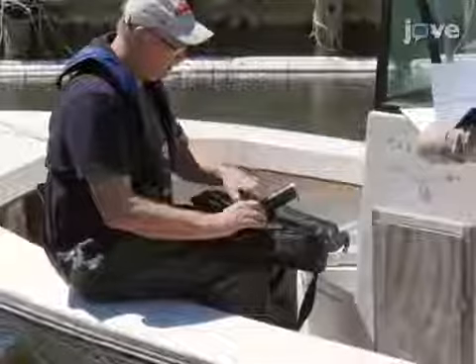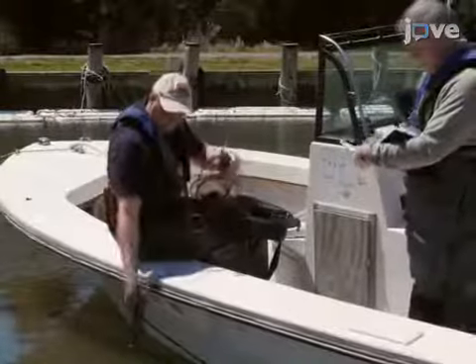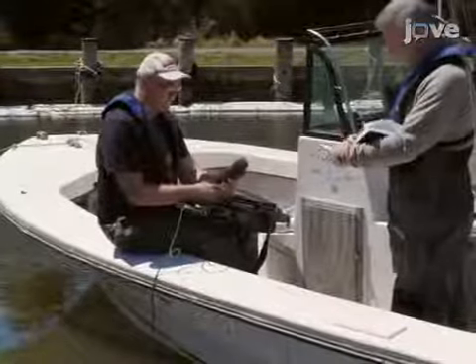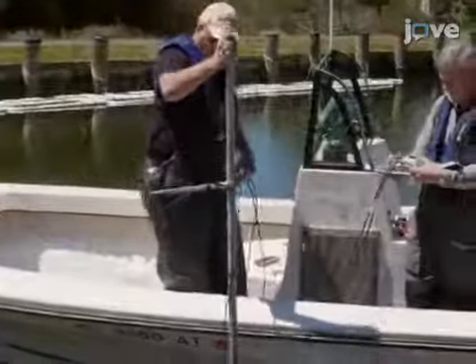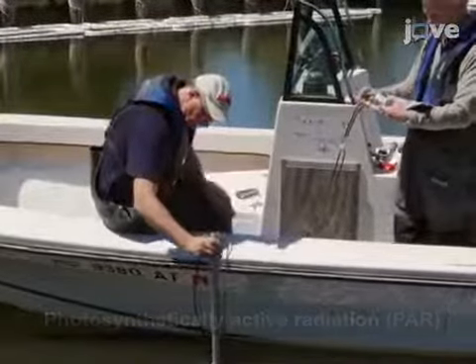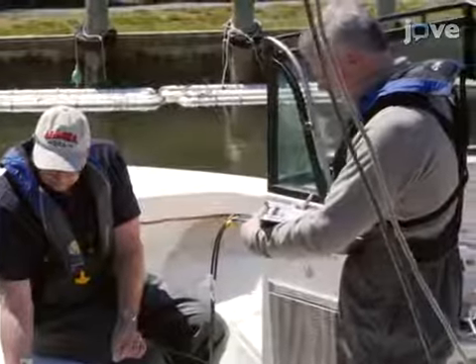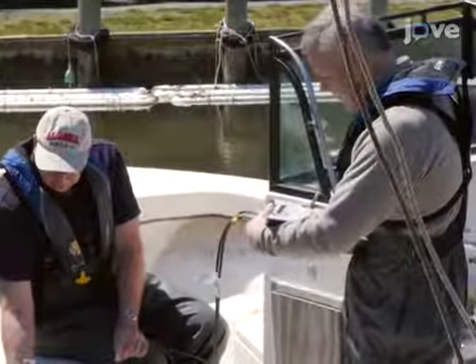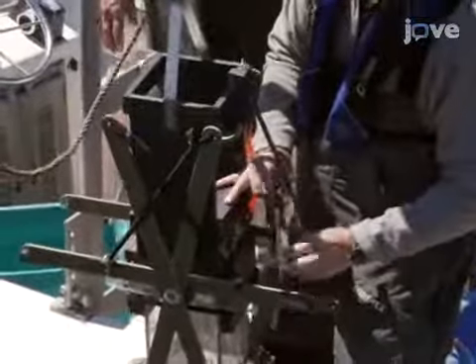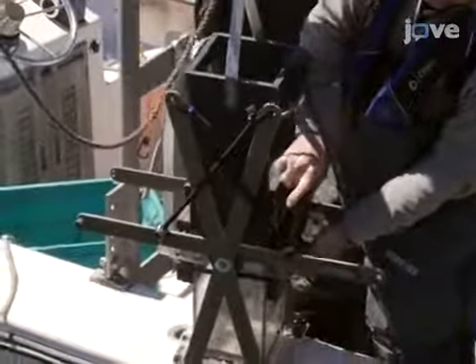Lower the YSI to about one meter above the sediment and take a reading. Next, take readings with a PAR meter and lowering frame at the surface and at the bottom to estimate the light attenuation of the water.